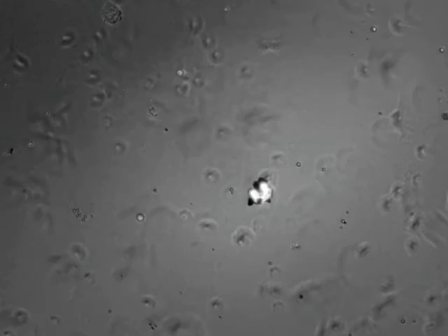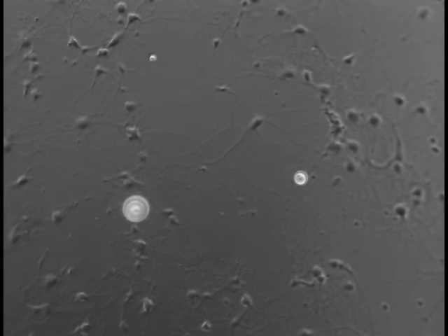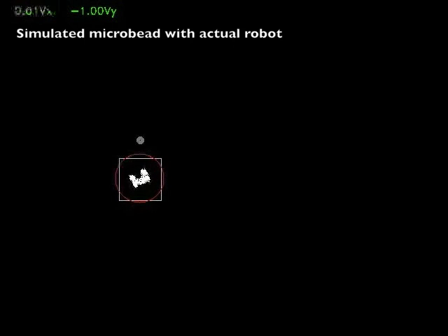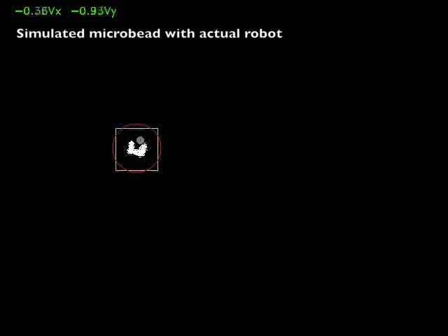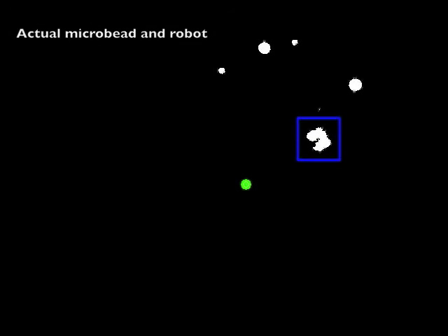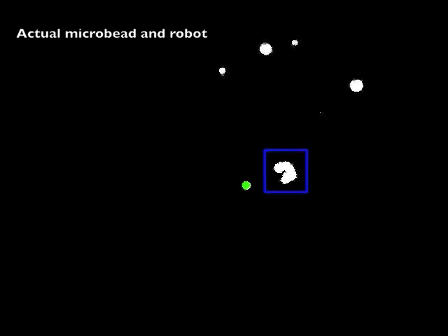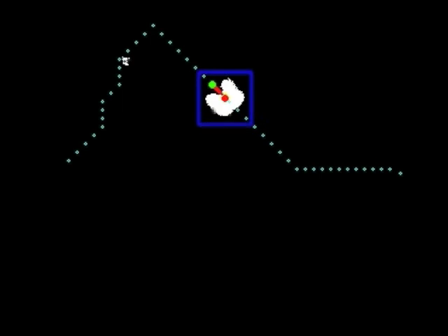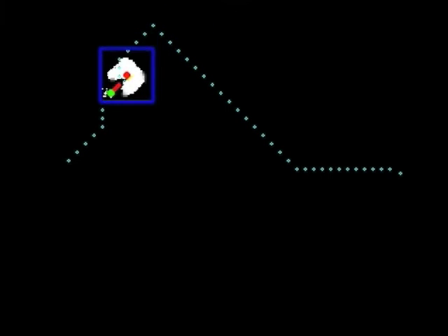For tracking the robot, the microscope illumination method is switched to fluorescence mode. The magnetic transporter is fabricated using an autofluorescent material, and the beads are tagged with fluorophores. Fluorescence-based tracking is an effective method to filter out all objects in the image except for the bead and the robot, and in turn greatly reduces the complexity and computational cost of tracking algorithms. We track the centroid of the robot and separately track the bead with the circle detecting method that uses the Hough transform. A PID controller is applied to adjust the position and orientation of the microrobotic transporter.